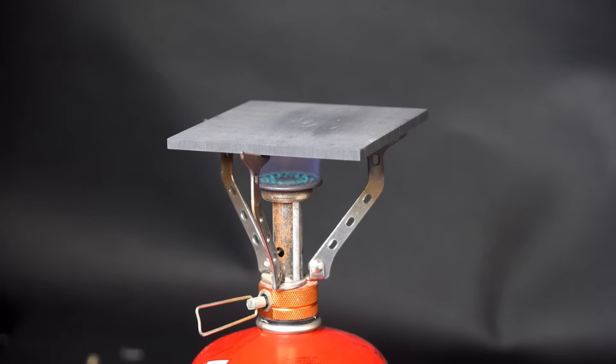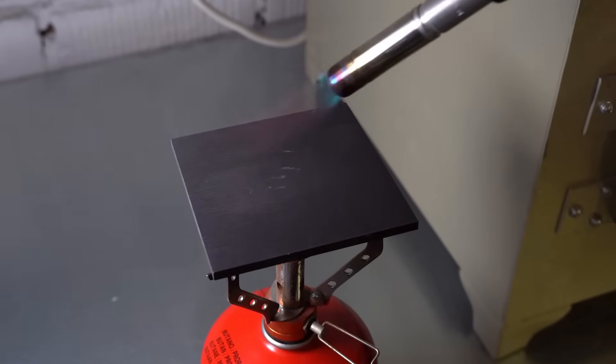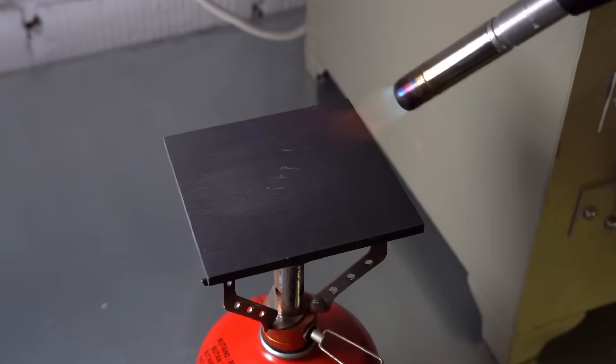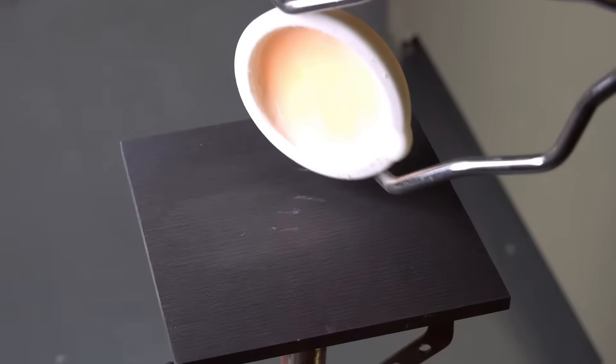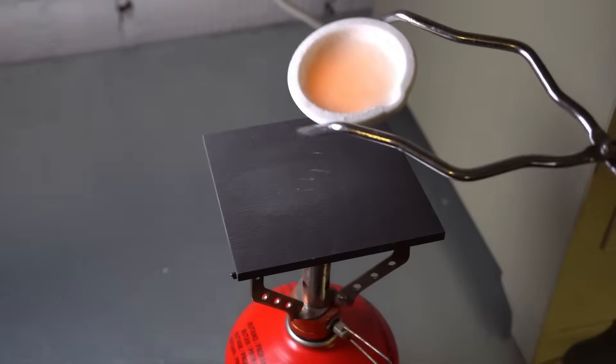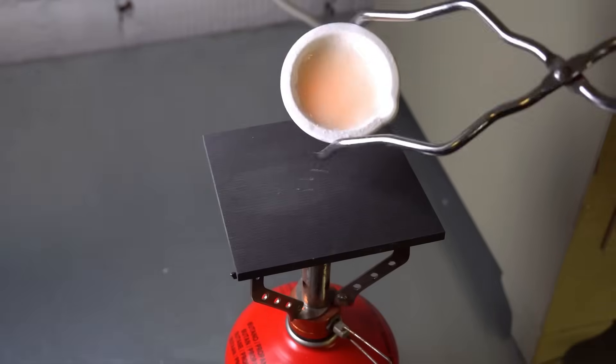Judging by the color of the furnace's glow, the temperature here has exceeded 900 degrees, and the glass should already be molten. But for some reason, this still didn't happen, and the contents of the crucible remained somewhat semi-solid. Perhaps I didn't put in enough batch, so I decided to add more to the crucible and heat it again in the microwave. While my glass is heating up, I decided to prepare a place for casting glass ingots. For this, I took an ordinary graphite plate, since glass doesn't stick to it, and I also heated it over a gas burner so that the freshly made glass wouldn't cool down too quickly and crack from thermal shock. After reheating the crucible for the second time, I decided to pour out a bit of homemade glass for testing. But for some reason, even after 10 minutes of heating in the microwave, it remained almost solid and practically opaque. Perhaps some of the glass reacted with the quartz crucible, or maybe the composition of this glass just isn't very suitable for simple experiments. Apparently it's better to look for something more easily fusible and transparent.